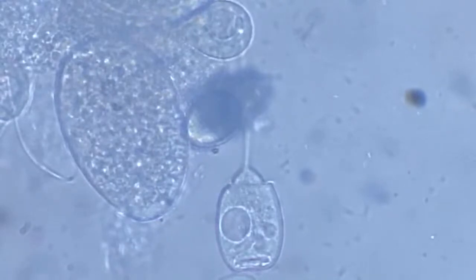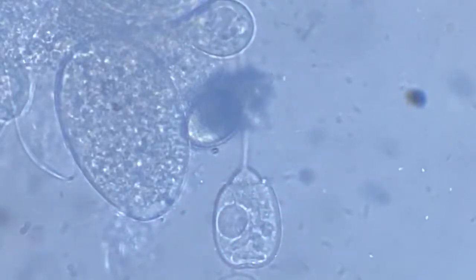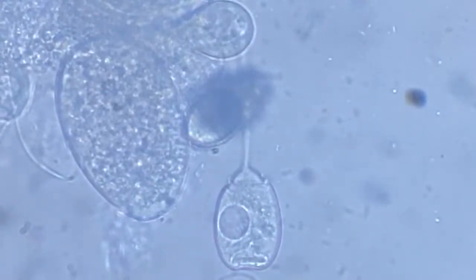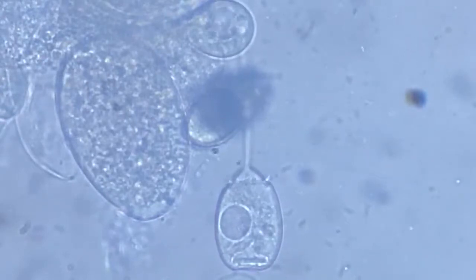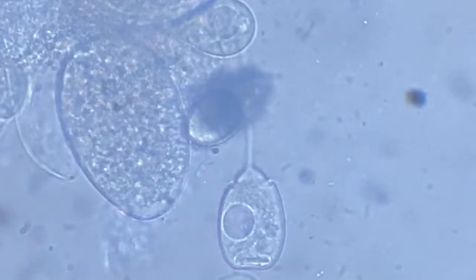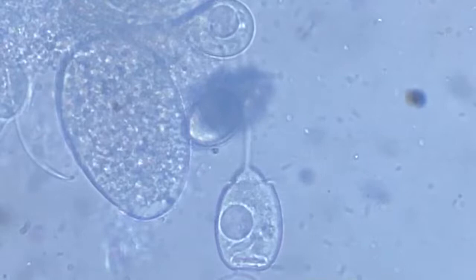This will be interesting. The vacuole has become... it flickered. The vacuole is still pretty big, and of course that's not the nucleus, because the nucleus won't increase so quickly. The beating is so rhythmic. Pretty rhythmic. Now the vacuole is real big. Around 20% of the volume of the entire cell is being occupied by the vacuole itself.